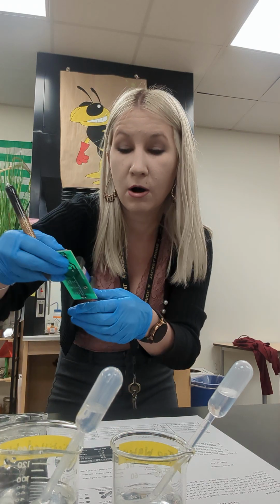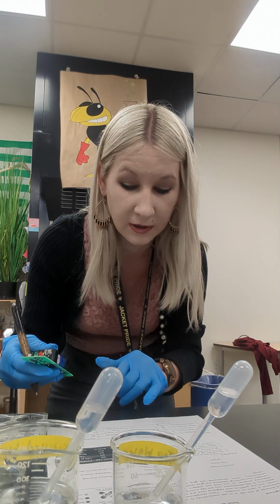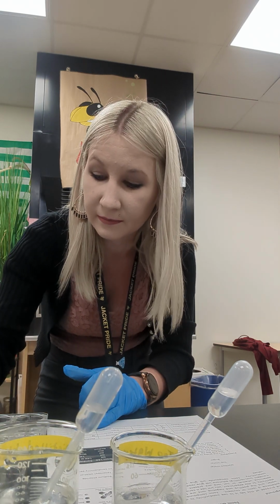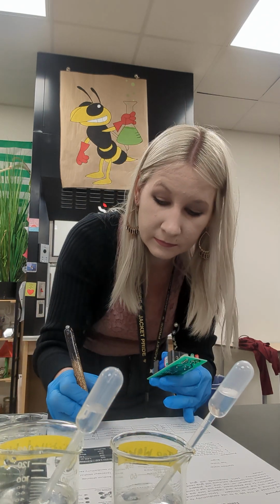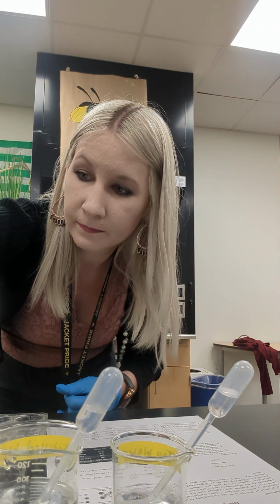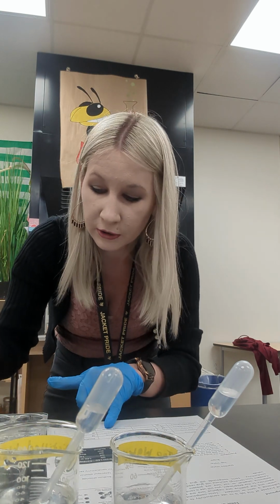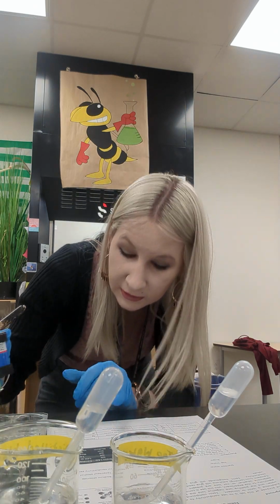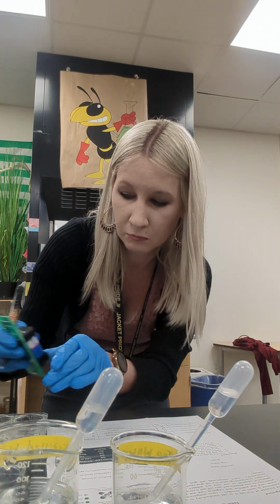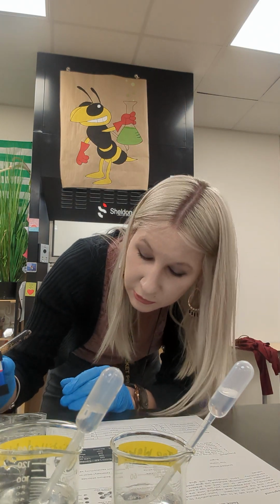Those are ionic compounds because we know they have a metal and a non-metal. They transfer those electrons to one another. Potassium iodide is also a 4. Let's rinse our probe. Sugar is next, glucose. No signal. That's no signal at all, hardly even a red light. That's a true 0.